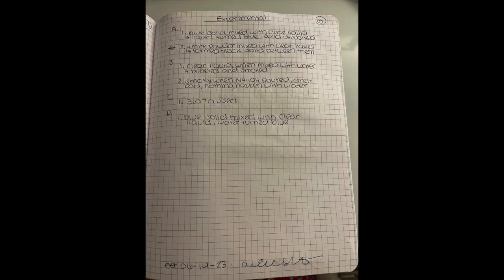Okay, so this page is my experimental page where I have my notes of observations that I'm seeing when I'm doing A, B, C, and D. So I have just qualities of the chemicals that I see. I've written down the gram amount that I've used, and just anything that I'm seeing while I'm preparing and doing the first reactions is on this page.